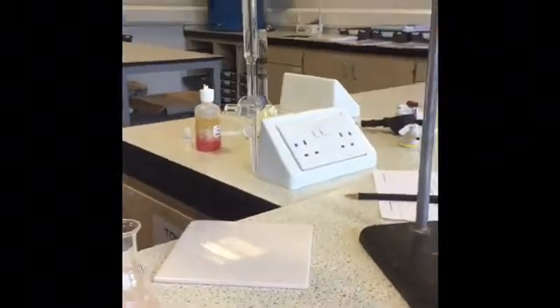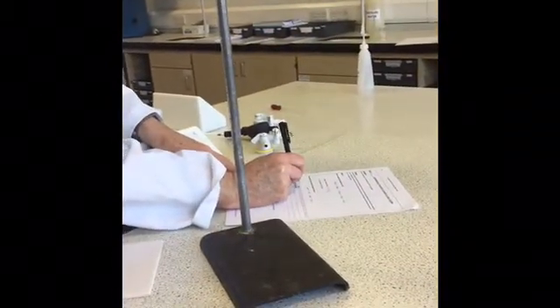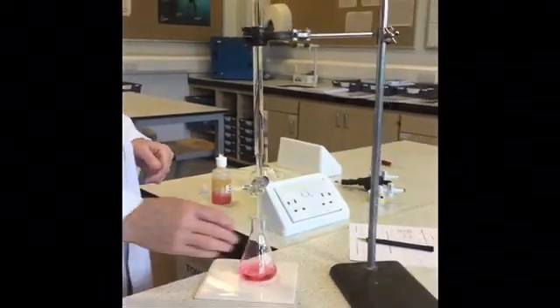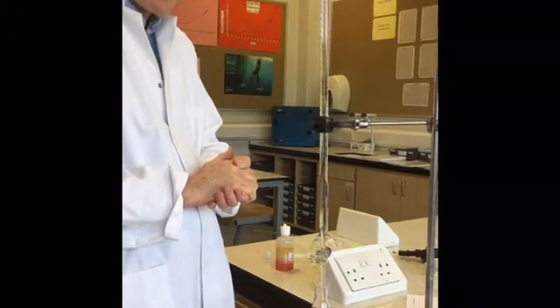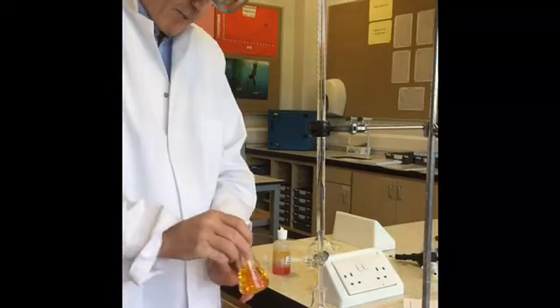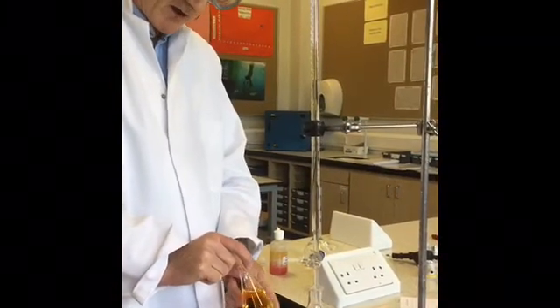I have already washed out the burette and filled it up with our standardised sodium hydroxide solution. So I record the starting volume for our rough titration in my lab book. And then I'll proceed to do the rough titration, and then as many accurate titrations as is required to get concordancy, remembering that at our end point we should see a solution which is more yellowy orange rather than pink.